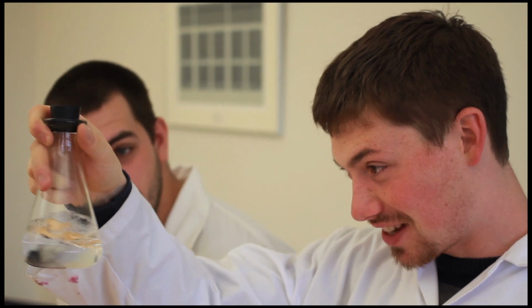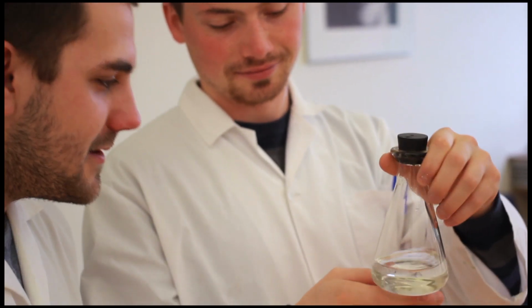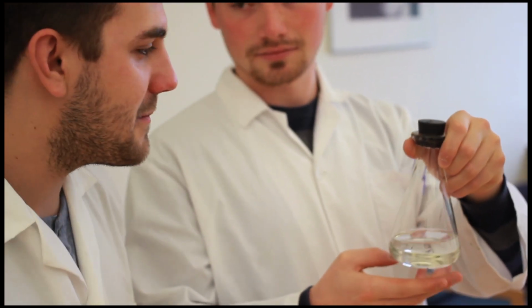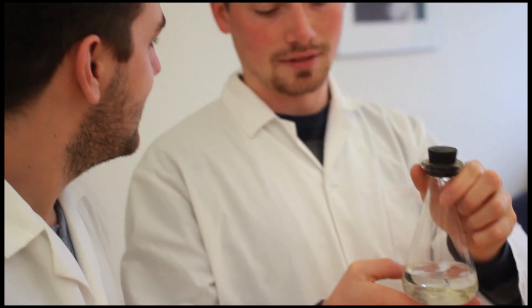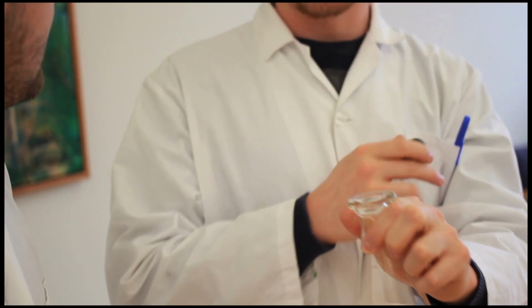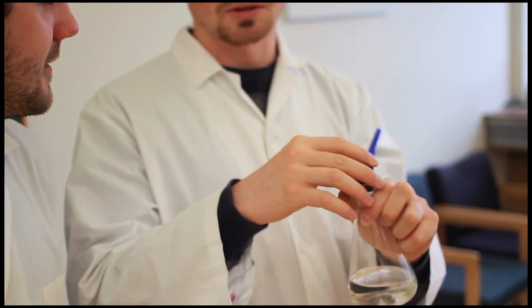Well, Jeff, you'll never guess what chemical I have today to work with. Want to take a guess? We got a clear solution. We've worked with rubbing alcohol in the past. Maybe waft it. Yeah, of course. Any odor? No odor. You might notice that I don't need safety gloves for this experiment, nor do I need goggles. Water? That's right, it's water.